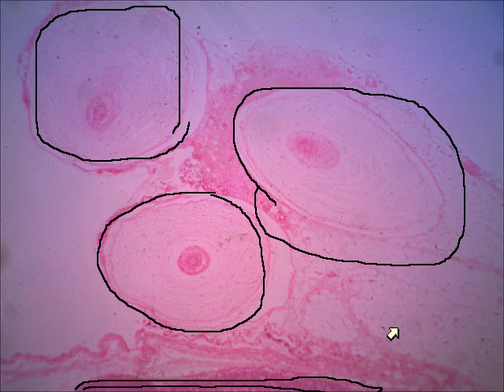Now this is the last slide in these recordings for exercise 30. But if you go to the other items that I've added in the slide folder, you'll see lots more, especially Pacinian corpuscles, and you'll see some labeled skin that shows the Meissner's corpuscles. So make sure you study those. Okay, well that's all for this recording.